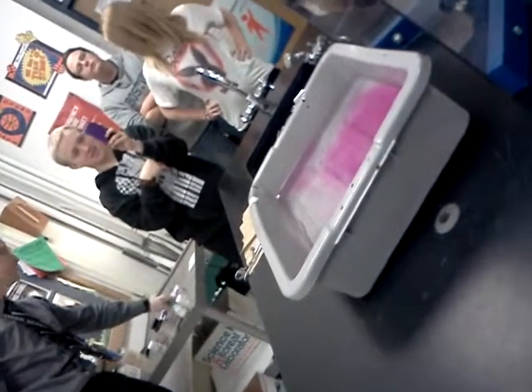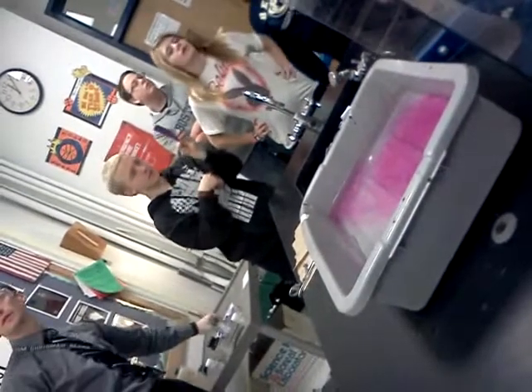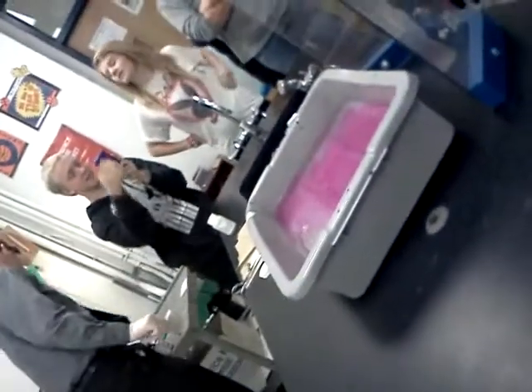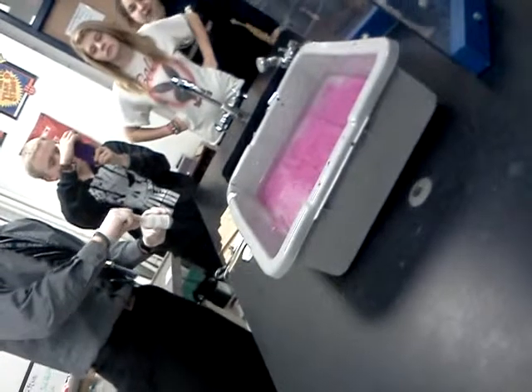This is lithium metal. It's element 3. Anybody researching lithium for their project? Highly reactive with water. It's almost out.